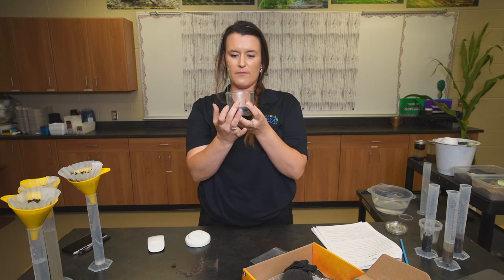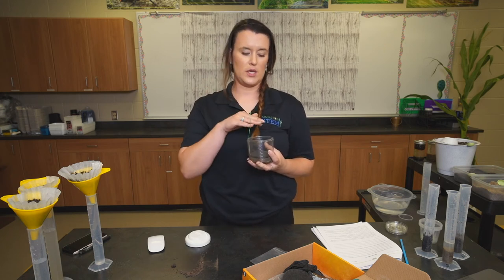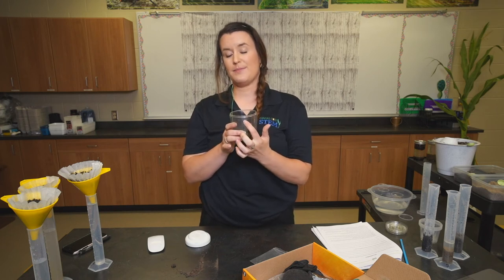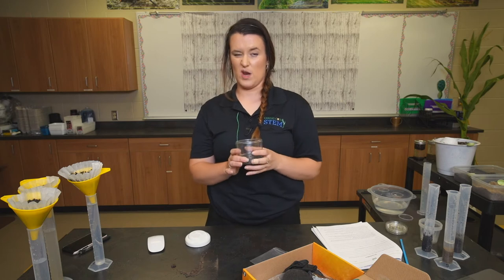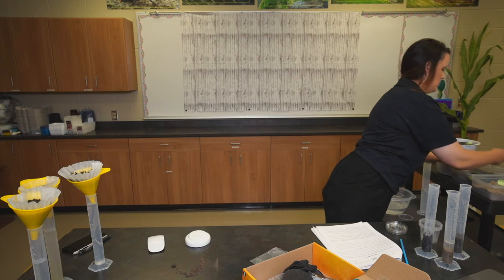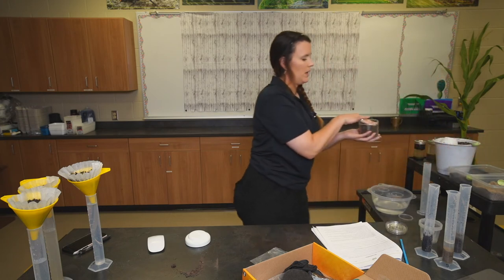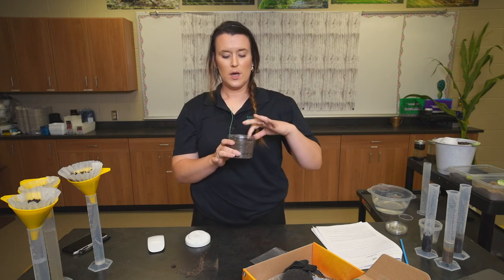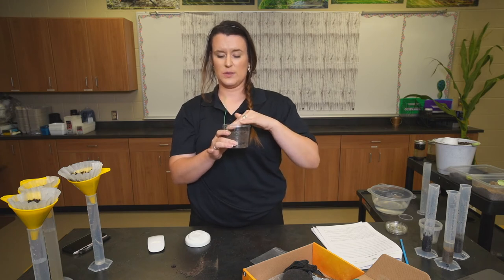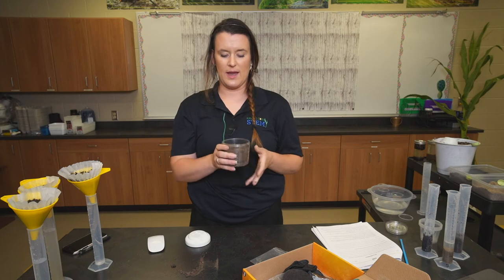Once the anode wire is inserted, lay the anode on top of the wet soil. Fill about four more centimeters up to the five-centimeter mark with that same texture of soil — not too wet, but damp and compacted. Don't fill past six centimeters because you really need a good air pocket. If you don't have a solid air pocket, you can tamper with results and potentially make your MudWatt ineffective. Students don't need to remove grass or plant matter — just smush it in. If there are huge rock chunks, feel free to remove those.